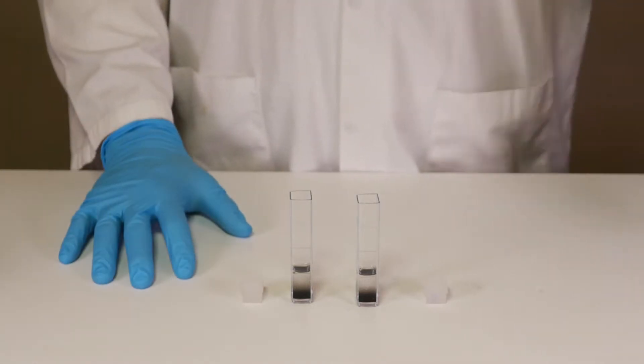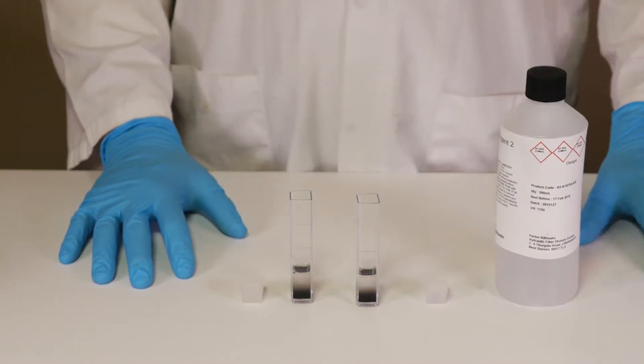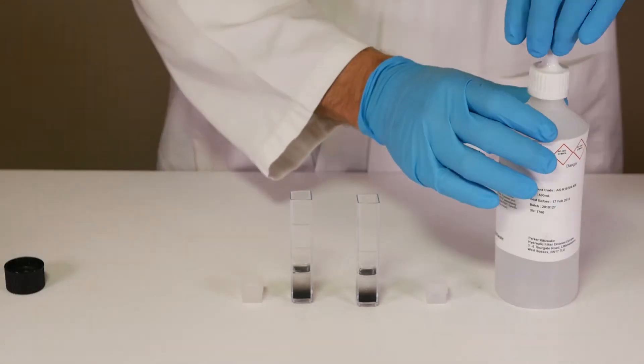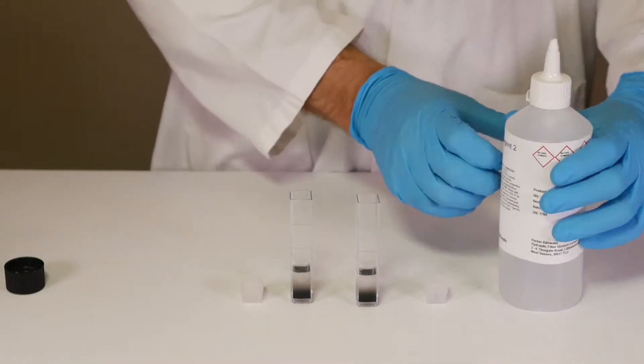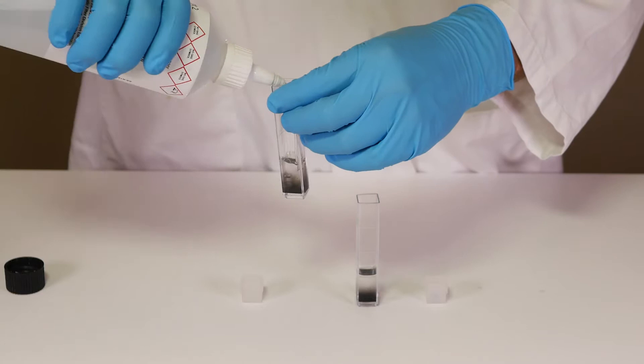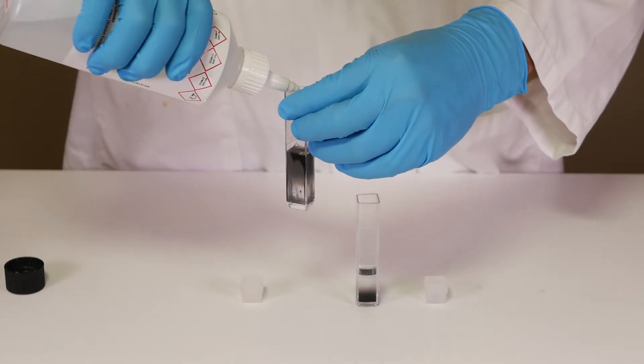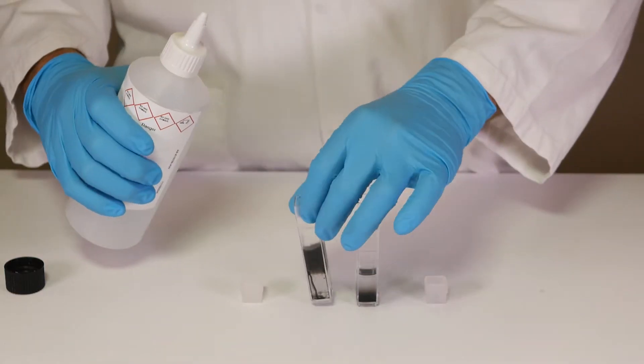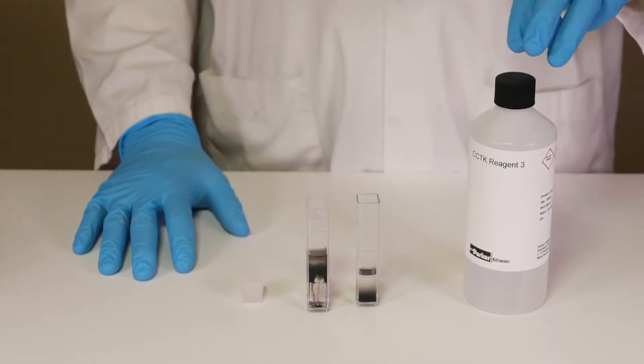Fill one of your cuvettes to the 10 milliliter graduation line with reagent two, and the other with reagent three.